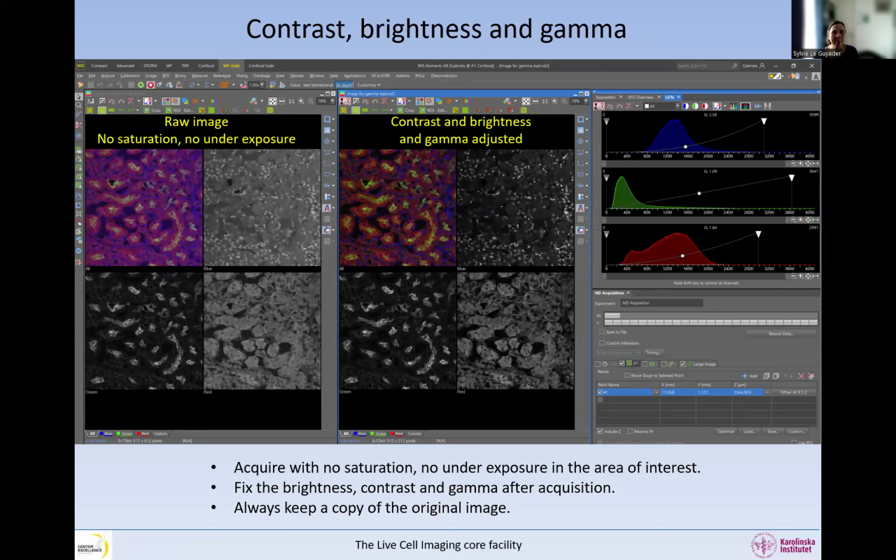Okay, so you want to acquire everything without saturation and underexposure, and you want to fix the brightness, contrast, and gamma after acquisition, and you always work on the copy of the original image, especially in Fiji, because it's easy to change the original data, which is not so good. So here we have the raw image that we have now acquired with no saturation, no underexposure. And this is the first image that I showed you where this one was saturated. These were very, very dim. And you can see that we can completely fix the display in these images and make them look really nice by just changing the display. That's not an issue.